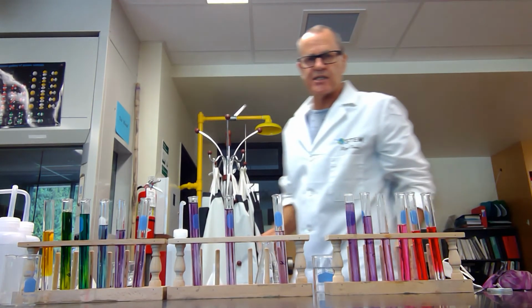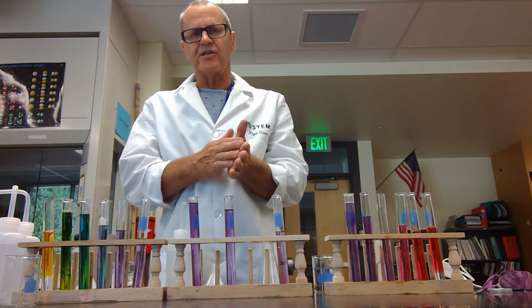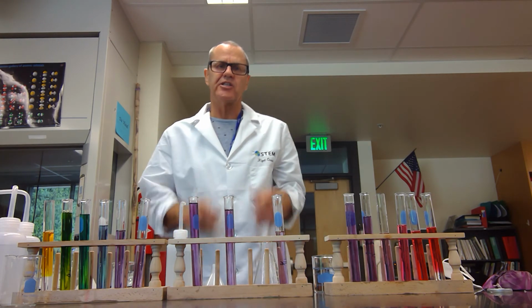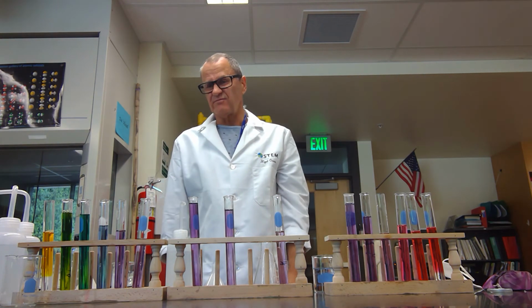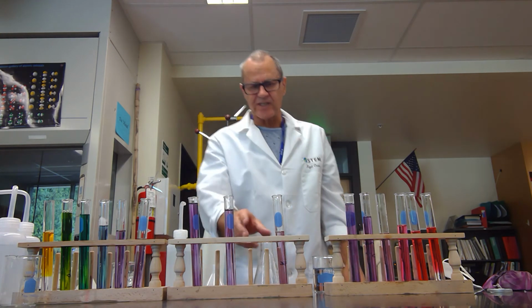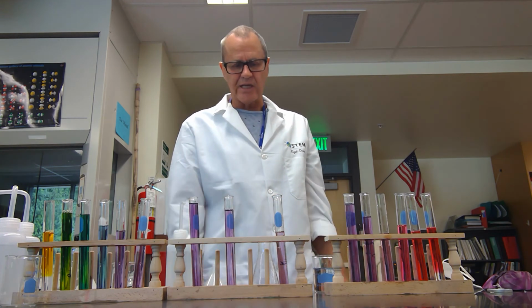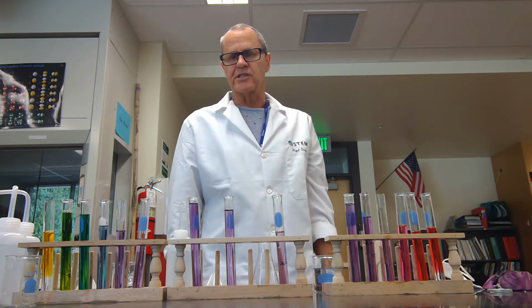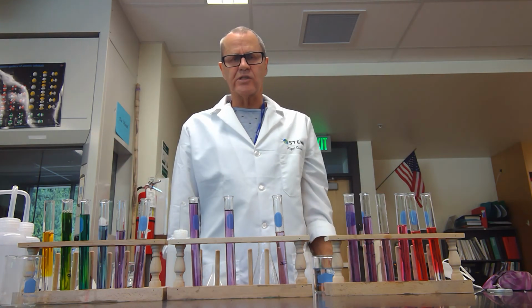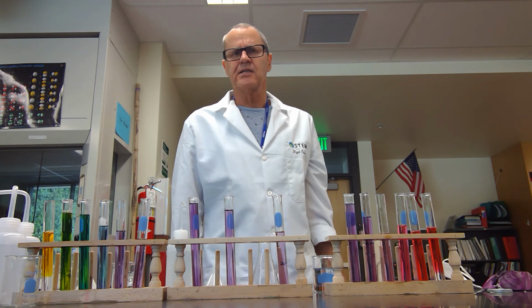Red cabbage indicator is truly awesome, and it's probably what we'd use instead of universal indicator if it didn't, 1, stink of cabbage, and 2, attract mold so quickly. You keep some of this in your lab. If I kept this in here, it's now Friday. If I came back in on Tuesday, it would be covered in mold on the top. So here's the colors, here's the qualitative data, and let's have a look at something else in a minute.